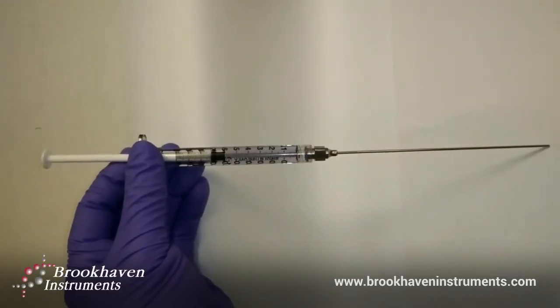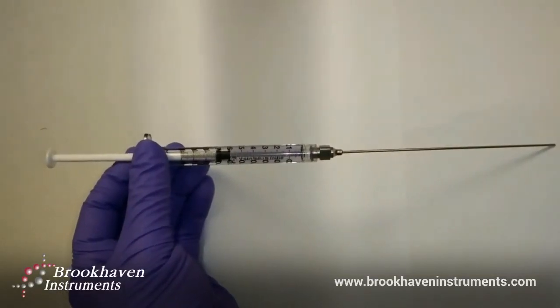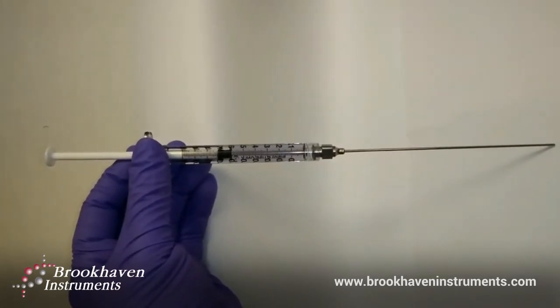Then, take at least 175 microliters of your sample in a syringe with a cannula, as shown here.